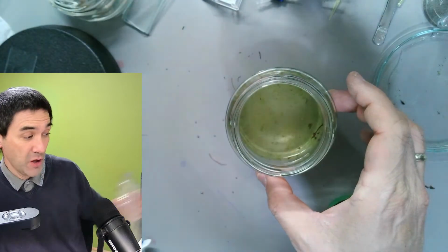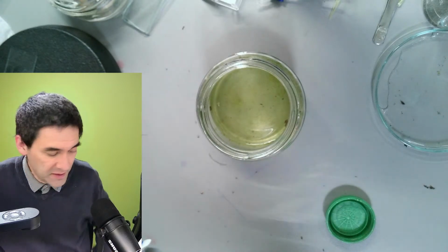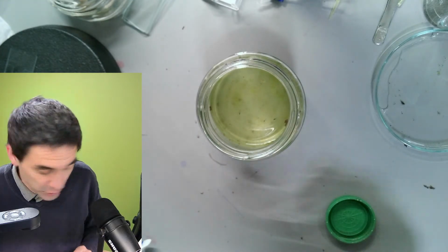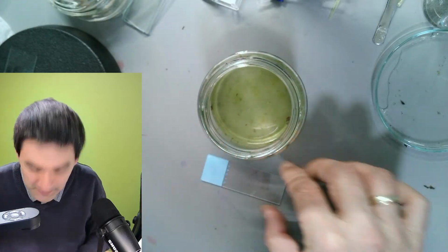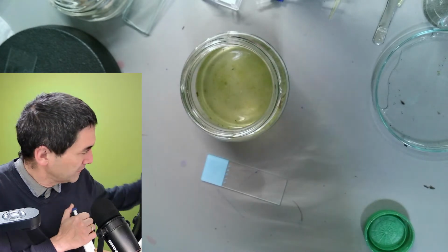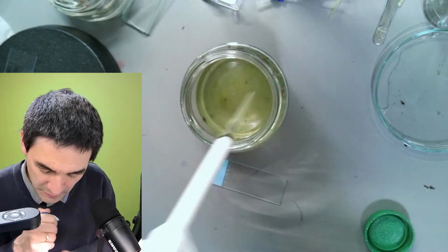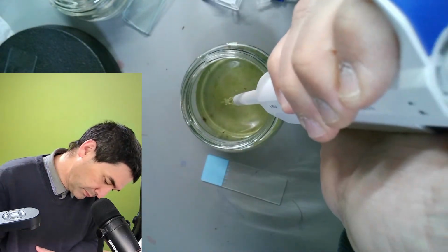So honestly, I have no idea what awaits us here. Okay, maybe interesting, maybe not, maybe a huge disappointment. In any case, one thing I can assure you, whatever we look at, it will probably be green. Oh, great. So, let's give it a try. If this is actually something of interest, then I'll make, of course, believe it or not, a separate video of this. Maybe some stuff is sinking to the bottom here and top.